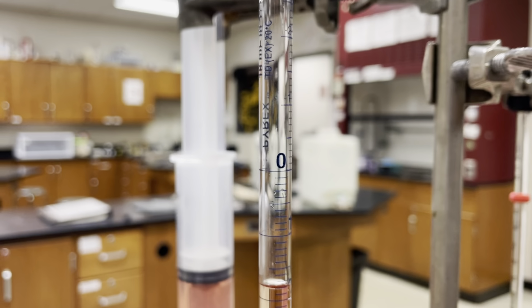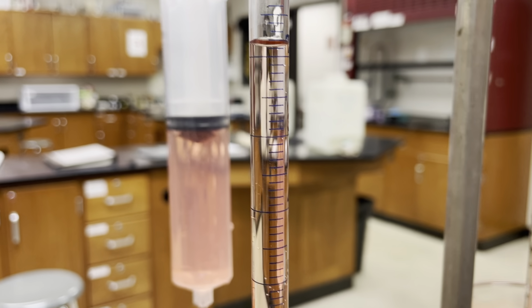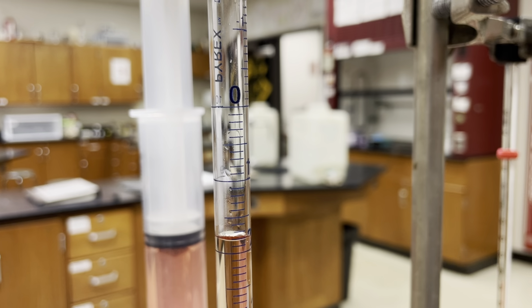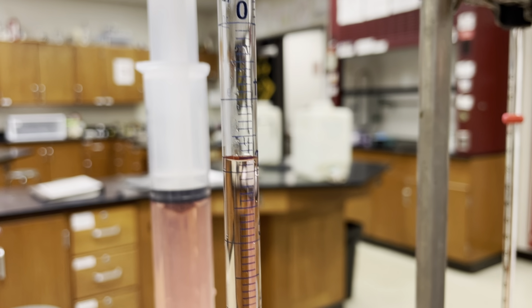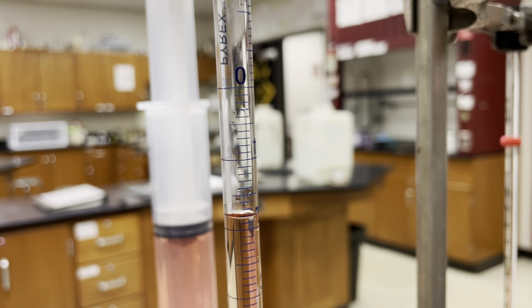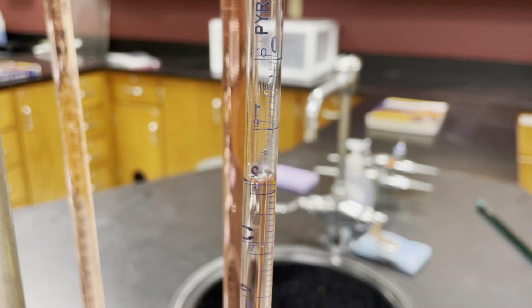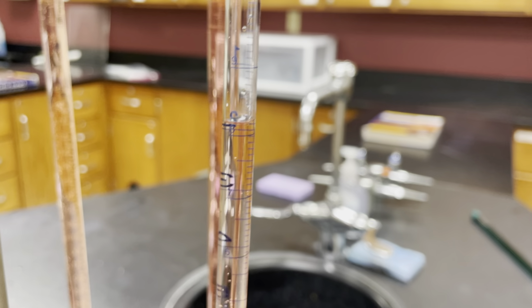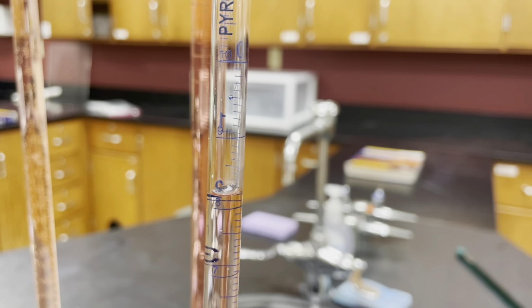Now, if you're working on dispensing a certain amount of milliliters, then you can go to the back side and look from the 0 down to the 1, down to the 2, down to the 3. And since the marks are on this side with the numbers, you can have a little bit more certainty in your 0.1, 0.2, 0.3 as you go downwards. Therefore, you can read between the lines a little bit to get into the hundredths place. Sometimes, depending on your glassware, it's not so easy and clear to figure some of this stuff out. But most of the glassware we use in the lab will either be pretty clear and straightforward, or you can always ask and talk about how we figure out the uncertainty of the measurement.